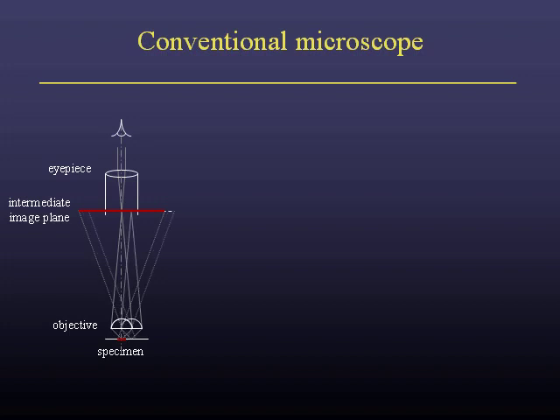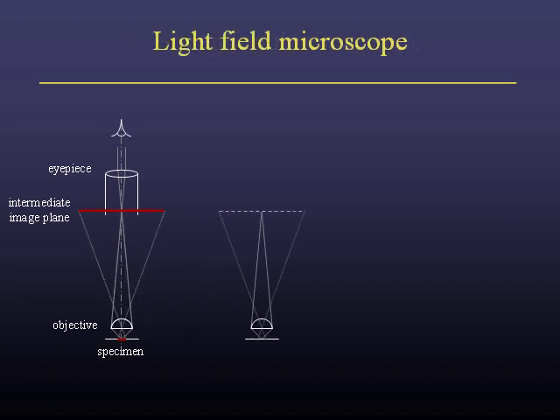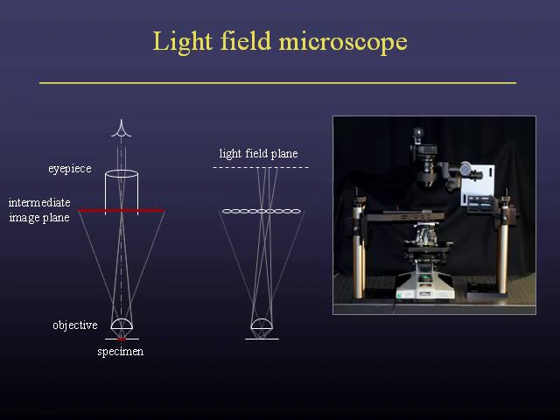In our light field microscope, we place a microlens array at the intermediate image plane. Rays that would normally come to a focus there instead pass through the microlenses and are recorded separately at a light field plane. Different points on the specimen are recorded in different small images on the light field plane. Here's our prototype, consisting of the bottom half of a microscope, the microlens array suspended above that, and a camera suspended above that, looking down at the microlens array through a relay lens.